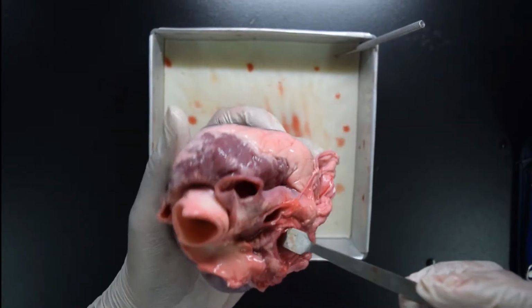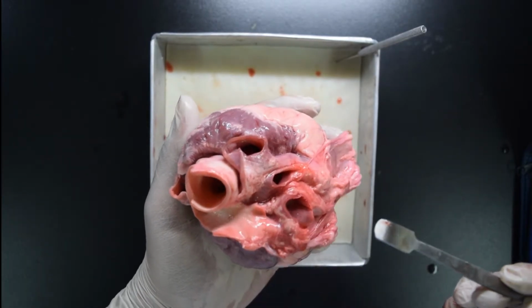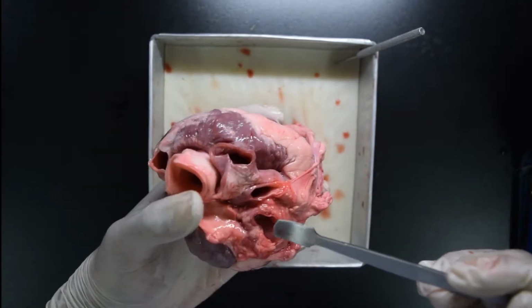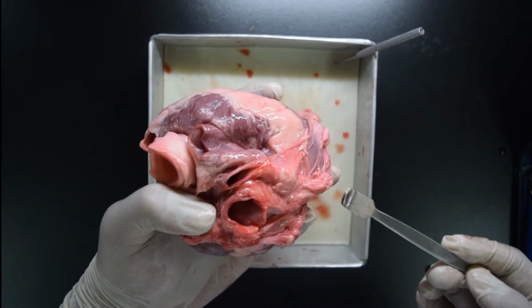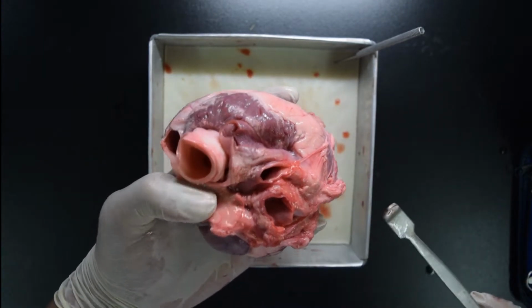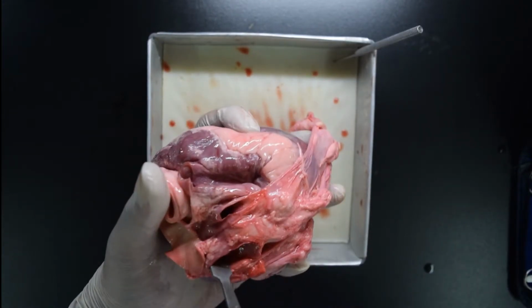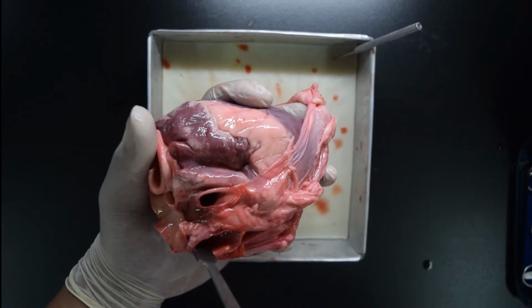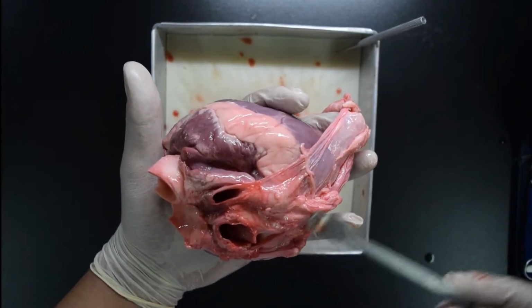After the pulmonary artery returns the deoxygenated blood to the lungs, it will be converted using the process of diffusion. It will turn into oxygenated blood. So the oxygenated blood now will go back to the heart through these two blood vessels we call pulmonary veins. This portion of the heart is the back portion of the heart, so you can see the pulmonary veins at the back portion.